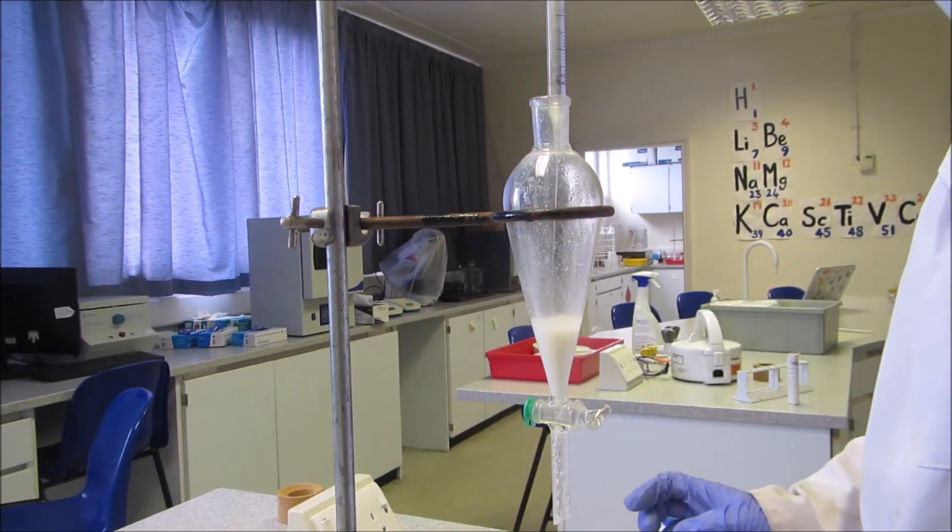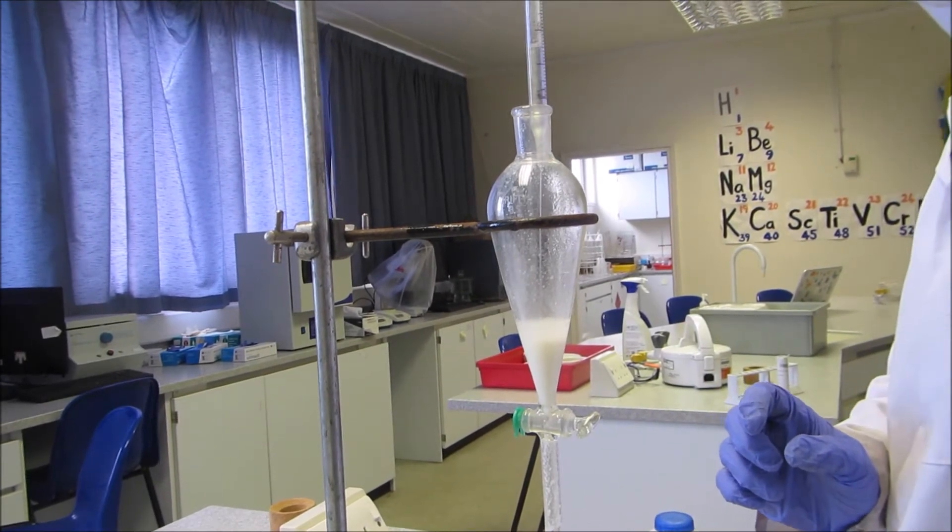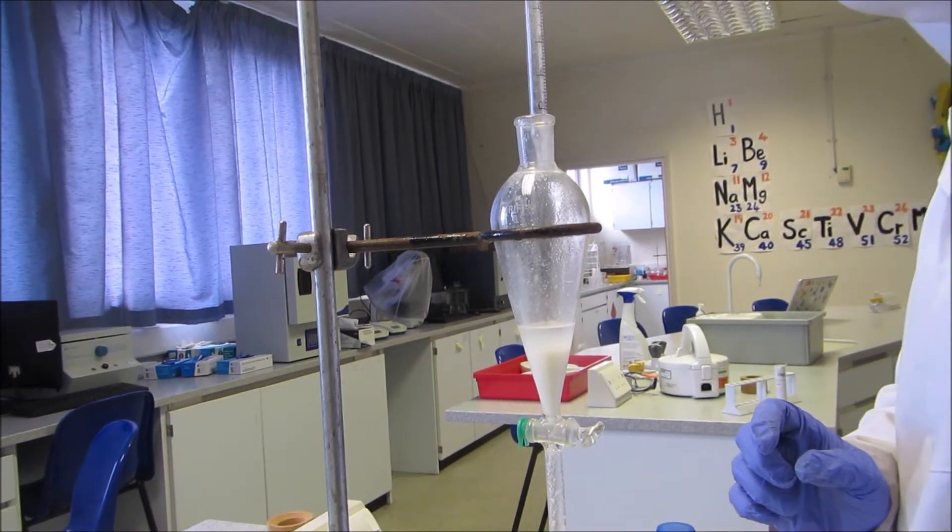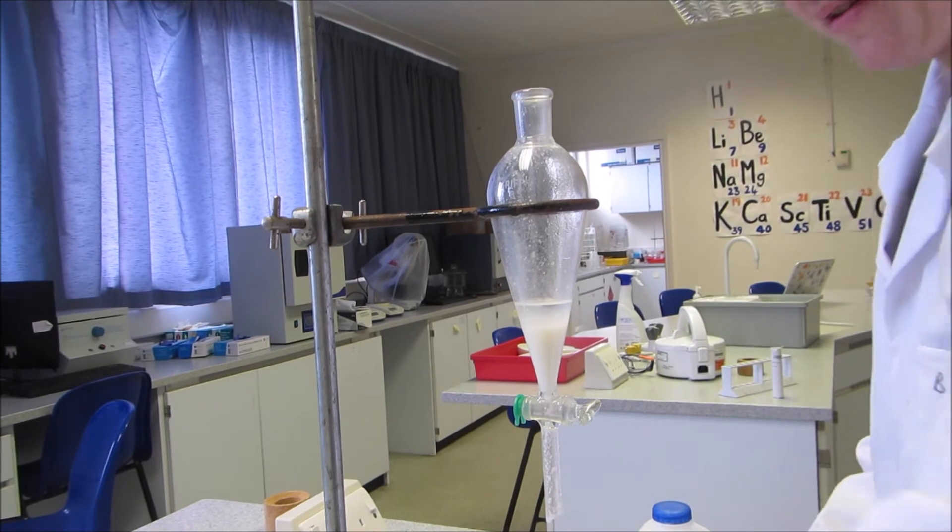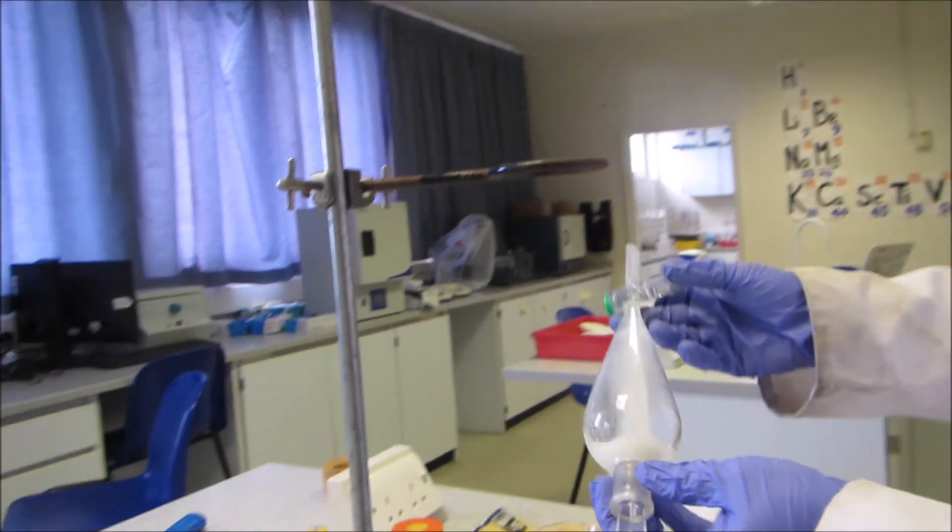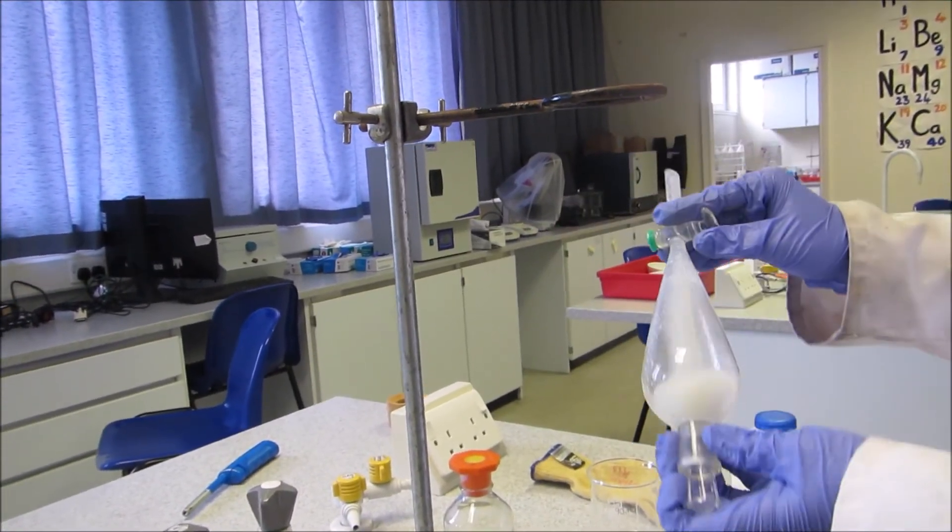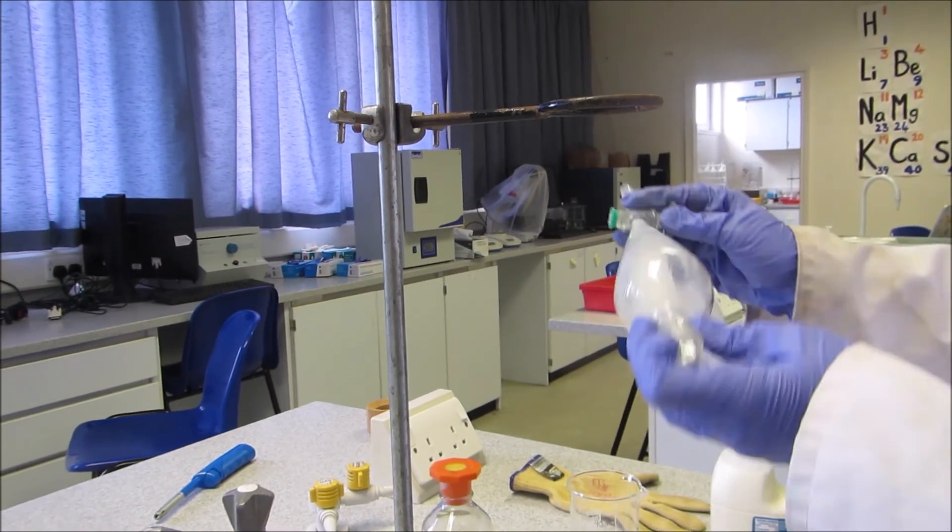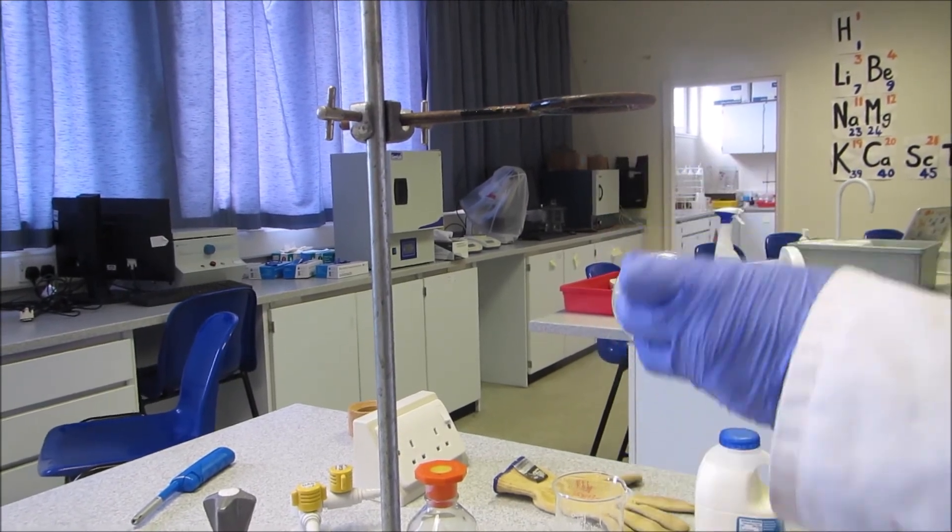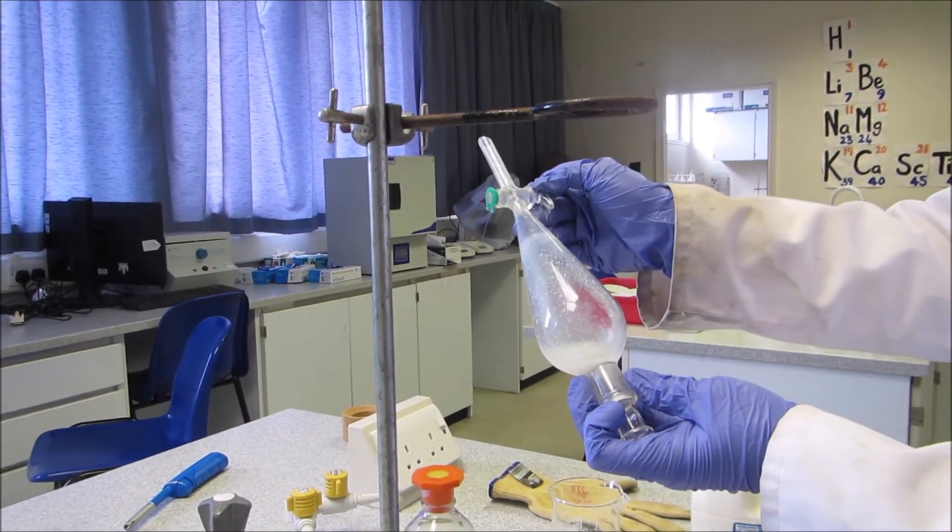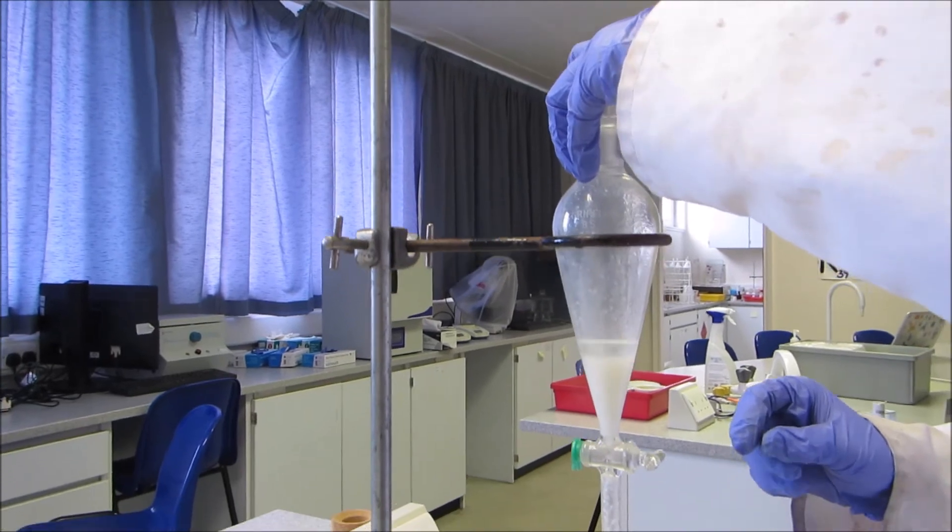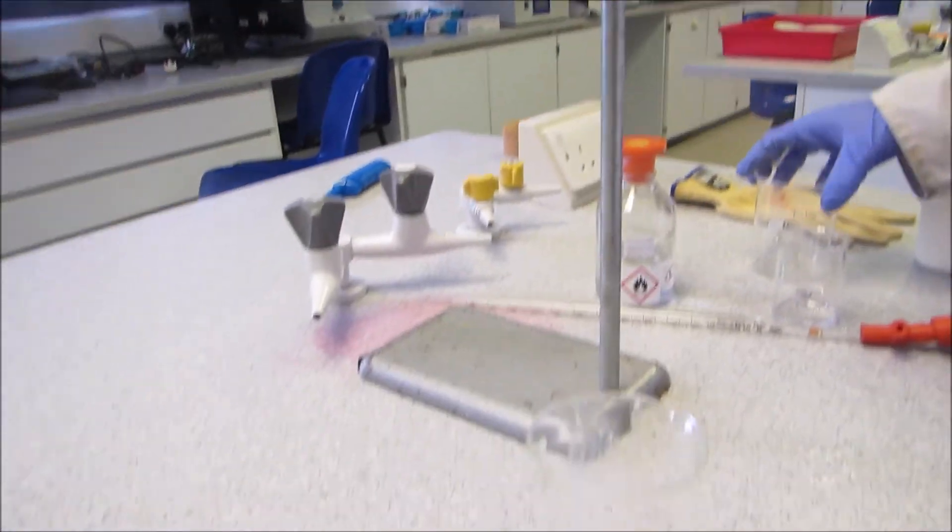I'll just put that in, and I'm just going to repeat what I did before with the shaking. So again, I'll let the layer separate, and then I'm going to discard the first layer and take the second layer in.